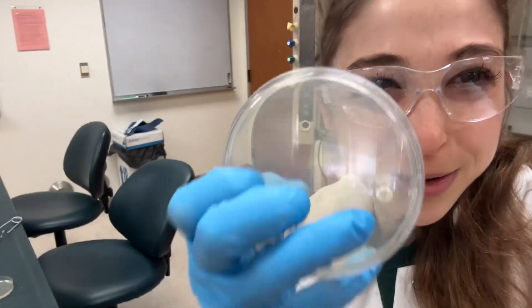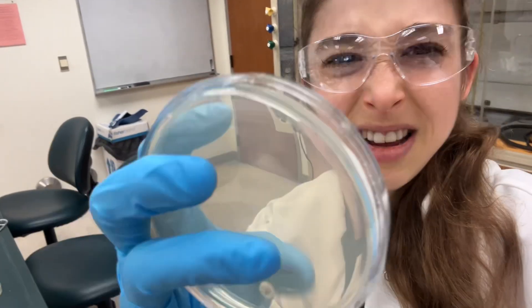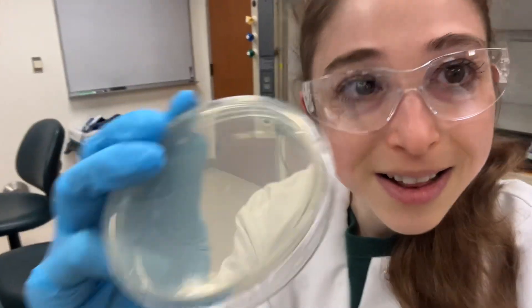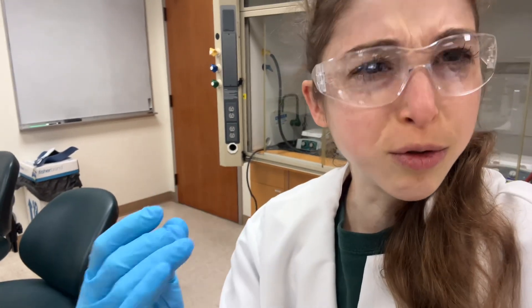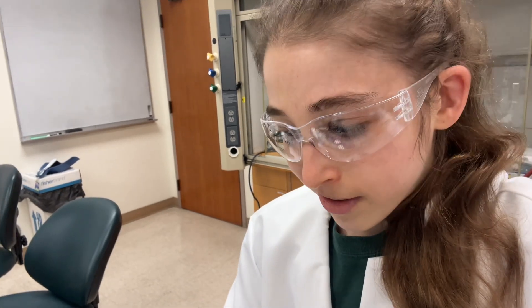These aren't actually blueberry pancakes, but I normally think of bacterial agar plates — your typical media plates — as kind of like bacterial pancakes. They're bacteria food, they look kind of like pancakes, and they smell really good to make. The reason they're blue is actually a dye — a bromocresol green dye — and basically it's just a pH indicator.